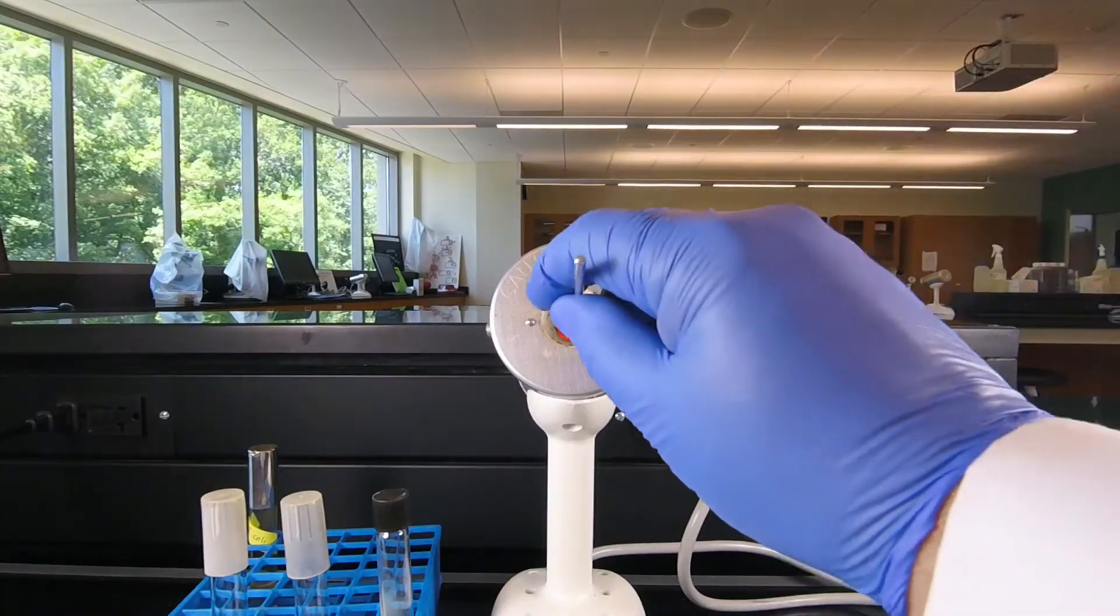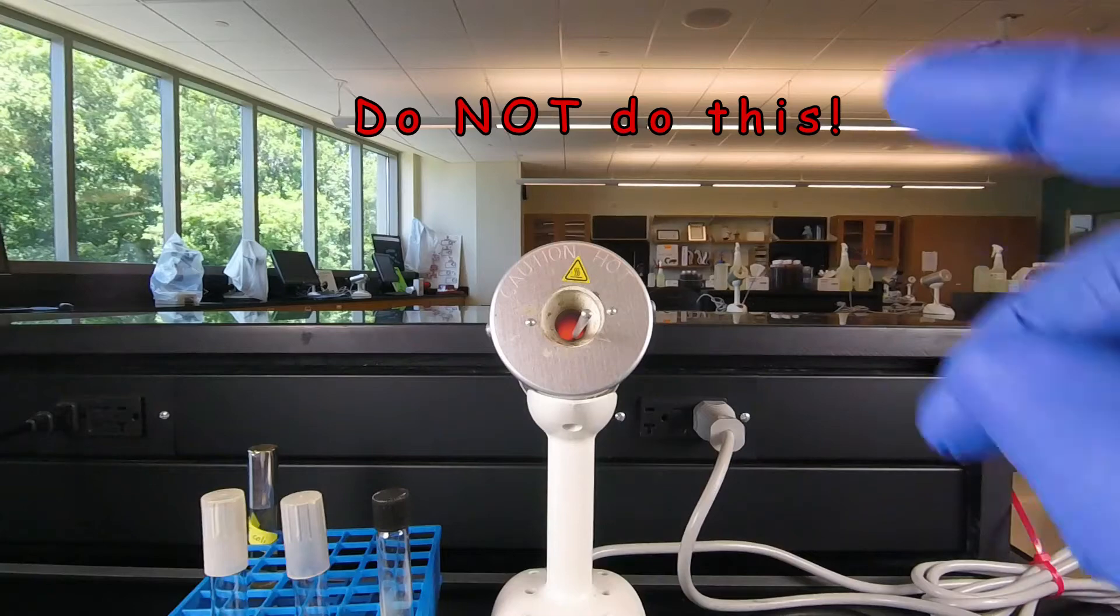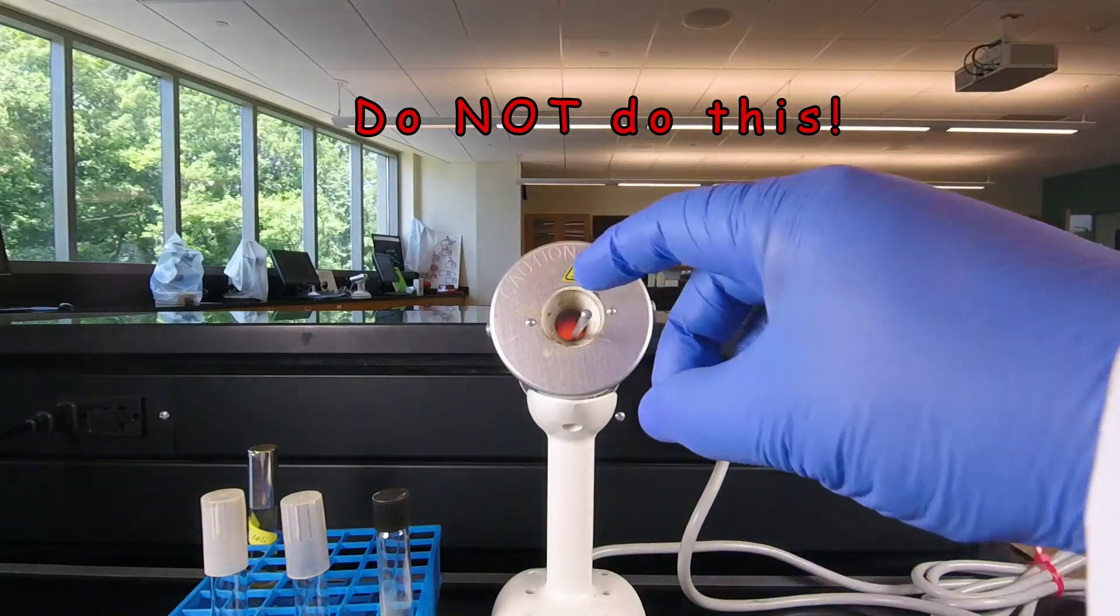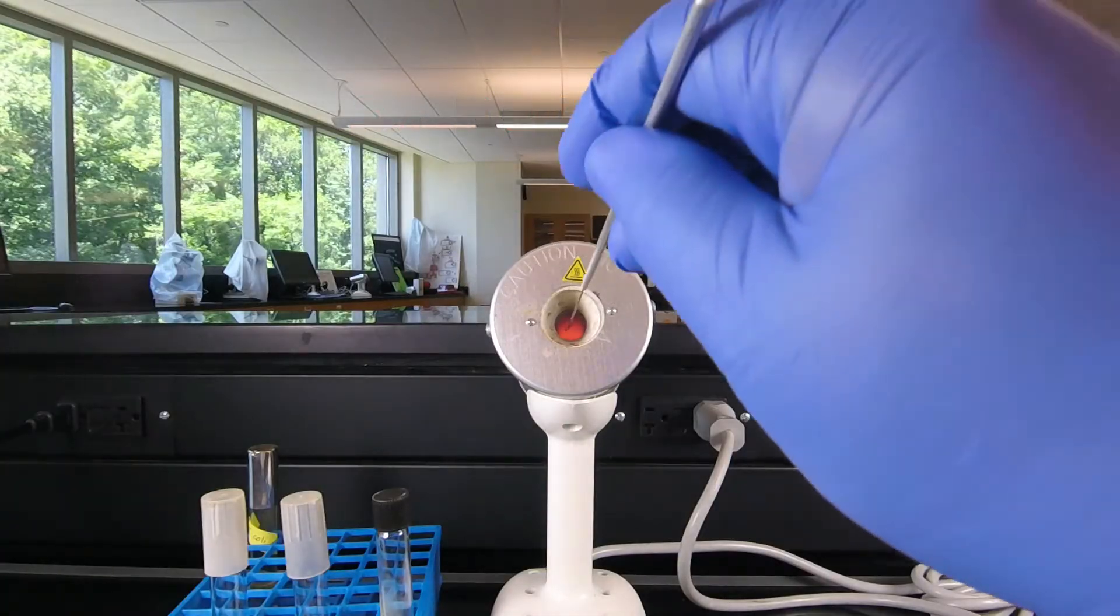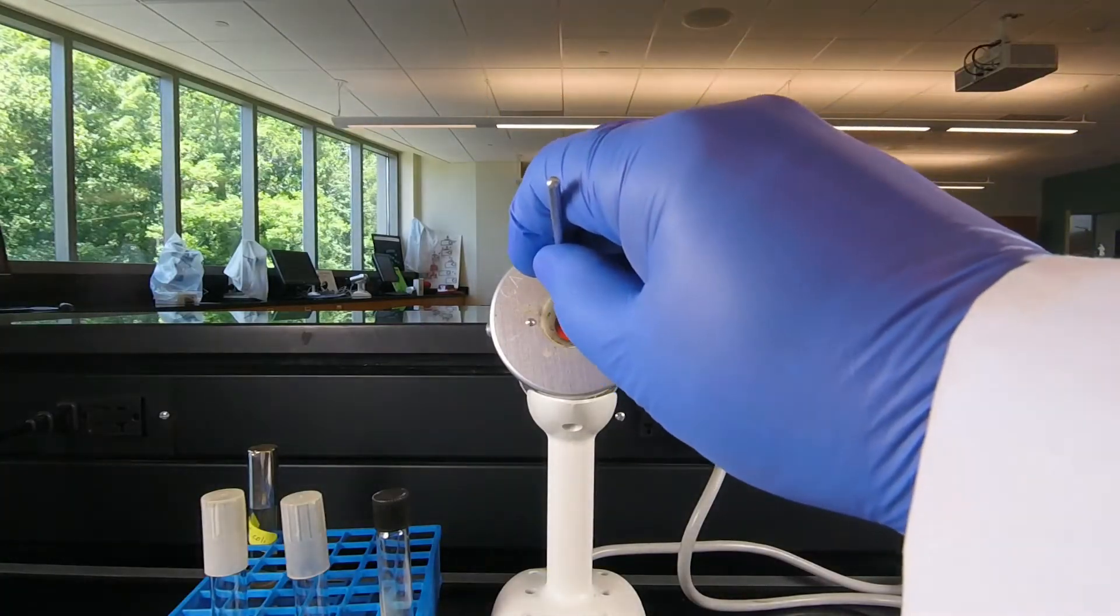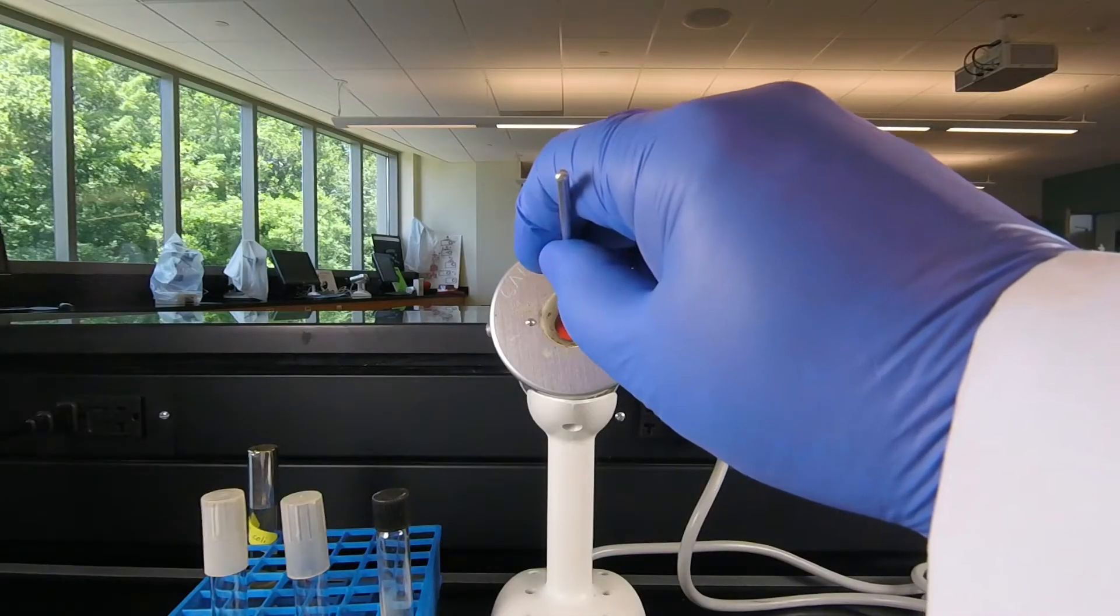Another important thing is not to leave it in there unattended to sterilize it. That gets very hot. That can heat the handle so much that you could burn yourself and it can even melt the metal of the handle. So when you're putting it in there for your ten seconds make sure you're holding it in your hand.